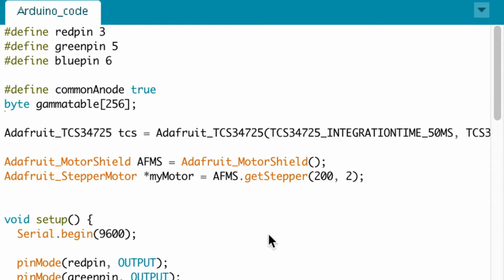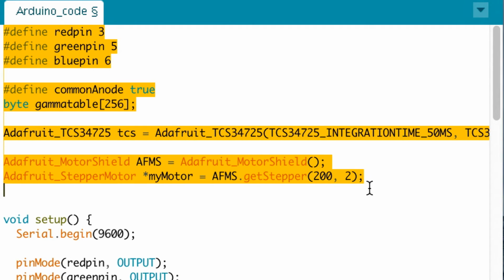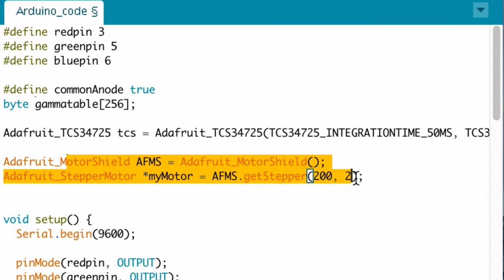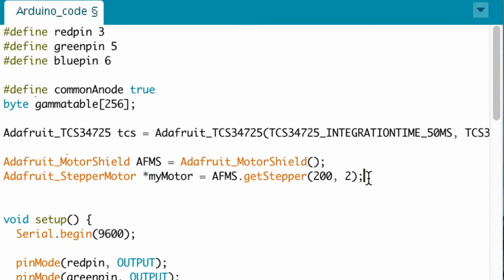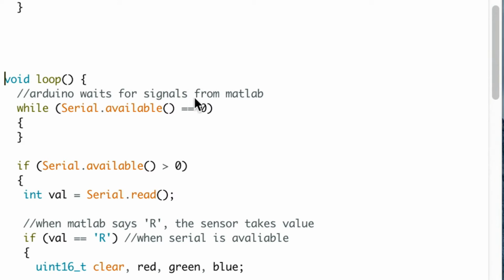I am John Deng. This is an explanation for the Arduino portion of the code. For the beginning of the Arduino code, we utilized lines 1 to 11 to define pins, variables, and include various Arduino and Adafruit libraries that we will be using. Next part of the code, we set up the serial communications with the Arduino board. We define the pins as output, and we set the value of rotations per minute for the motor here. From here to the end of the code will be the main function of the Arduino.